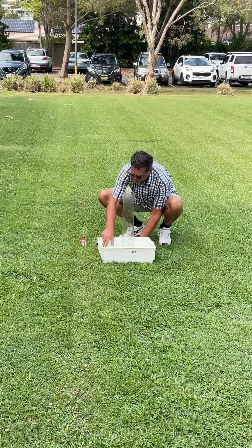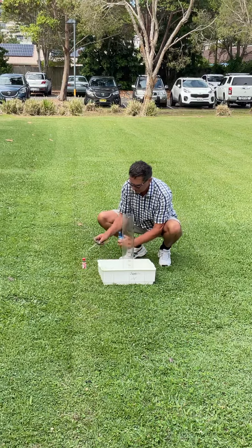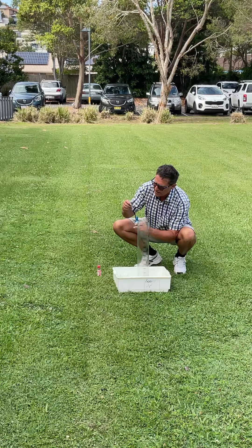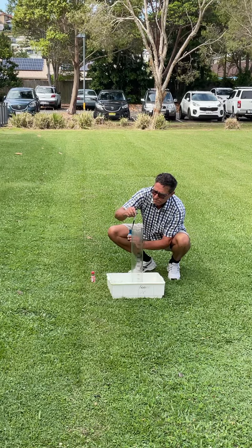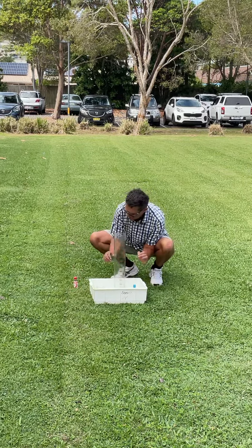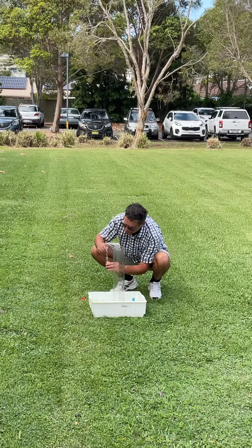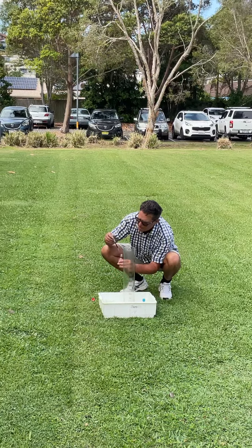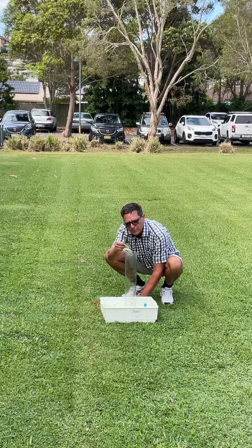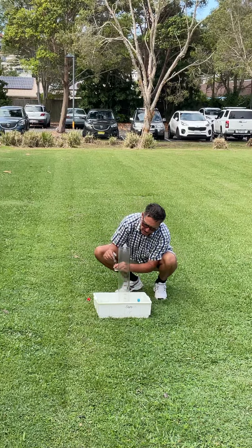What I want to do is make this one with a bit of difference — I want to make it striped elephant toothpaste. So we'll put a blue stripe down one side and a red stripe down the other side. I want the stripe to go down the side but not hit the bottom, otherwise it'll mix with the blue and make a purple running down that side.